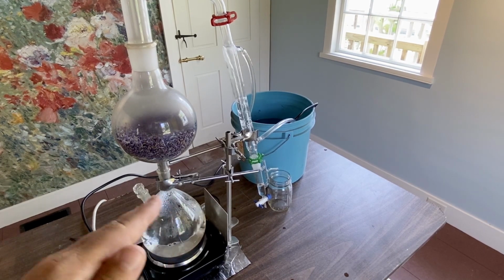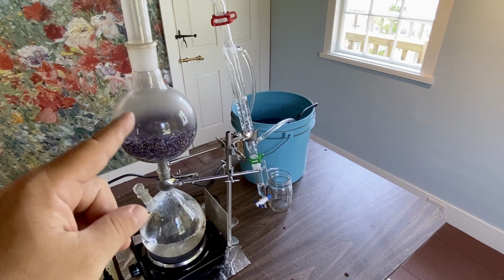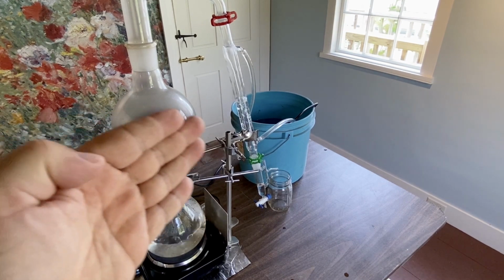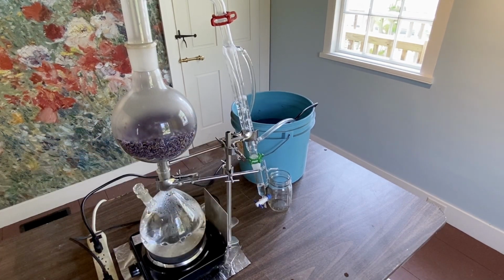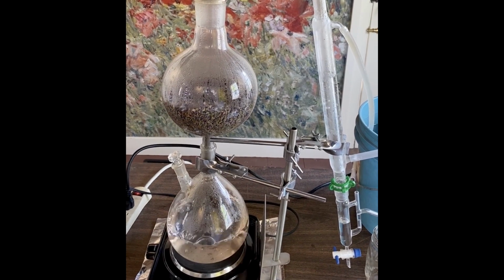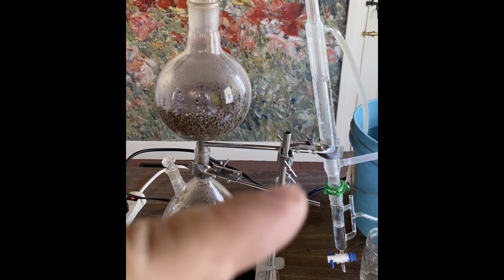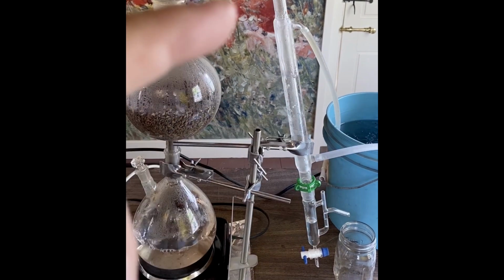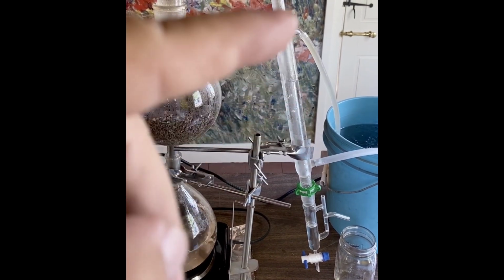If you go too much with temperature, you will start cooking your plant material. And that aroma and that flavor will eventually get distilled out to your final product. So be careful with temperature. Again, that steam is passing through that lavender flower and then coming to the right side and condensing. Okay, at this point I've got nice ice cold water circulating around that inner tube. So again, the condenser is a double tube, and every now and then you can see a drop of oil coming through as it condenses beyond that steam.